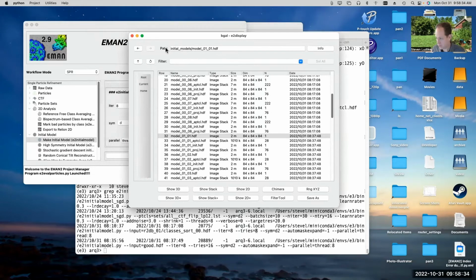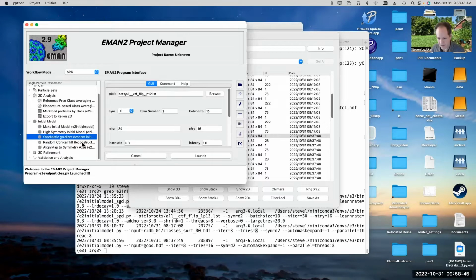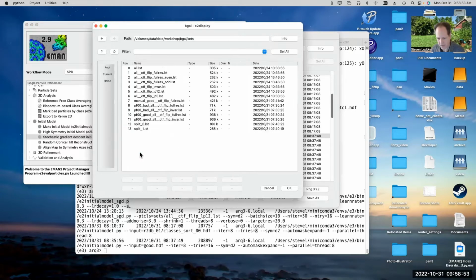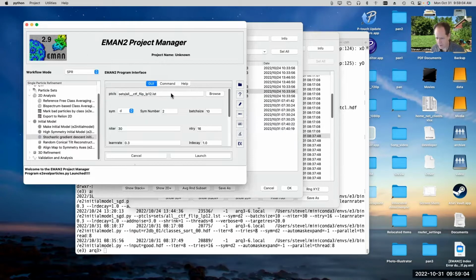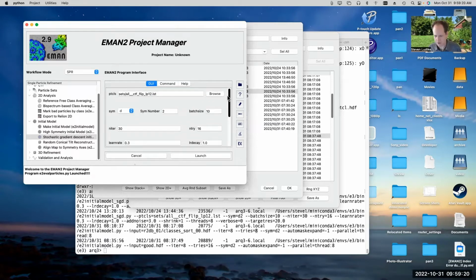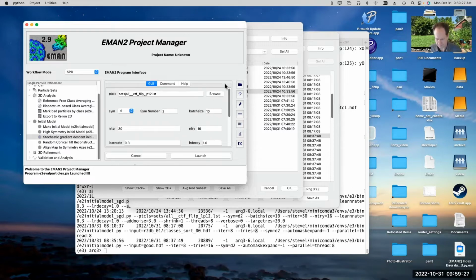Okay, so this was using the old initial model generator. I would actually suggest, generally speaking, using the new initial model generator, and it mentions it in the tutorial, even if it doesn't take you step by step through using it, mostly because it's pretty easy. So if we just pick stochastic gradient descent here, and we pick one of the raw particle sets, you could do it on the full resolution, but again, it'll run faster if we use one of the low pass filtered ones. So I would use LP12 or LP5 here. And just give it the raw data set, fill in the symmetry, and you can just leave the other parameters pretty much as they are. You probably want to update the number of threads to match the number of threads available on your machine. Other than that, though, the defaults are generally pretty good. You can change the number of tries if you want.